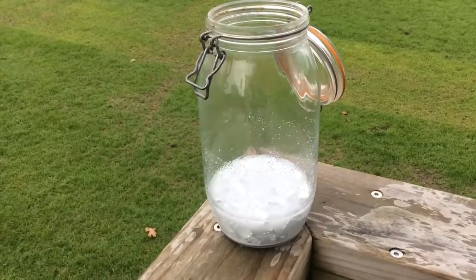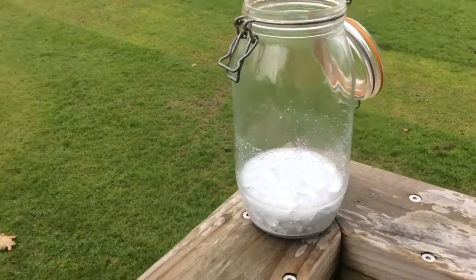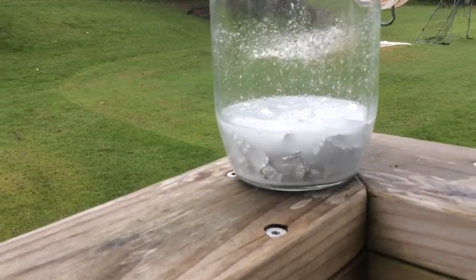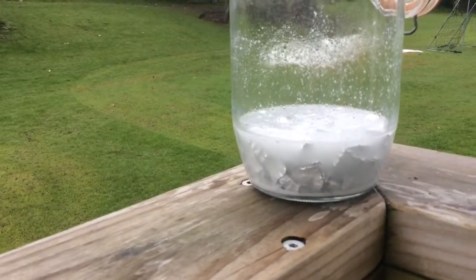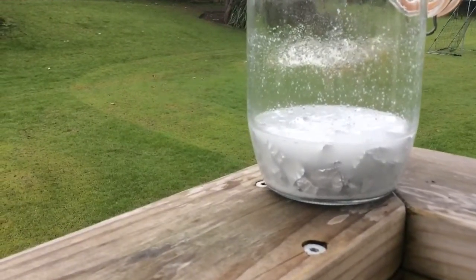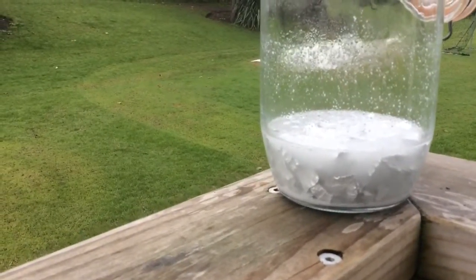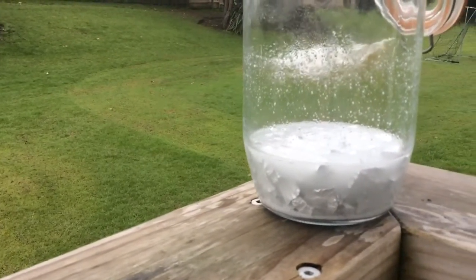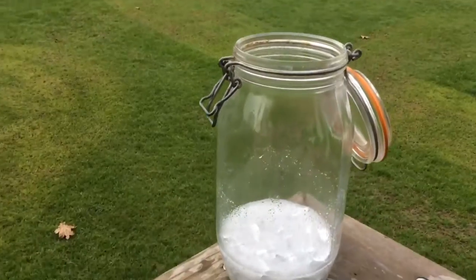So I've brought you a little bit closer so you can see the mixture before it really starts to go, and you can see in there that's the aluminum foil and the powder, and it's well mixed into the water now. There is somewhat of a reaction starting to happen already. There's a bit of movement in there. What we'll do is we'll just go over the jar.